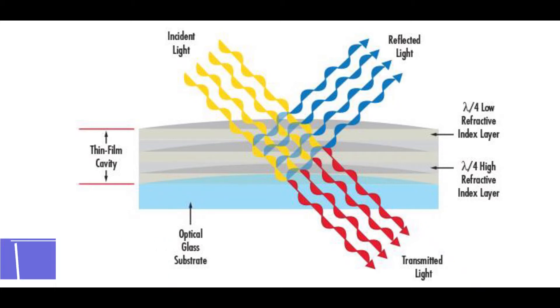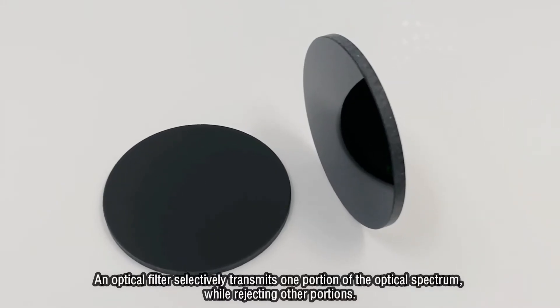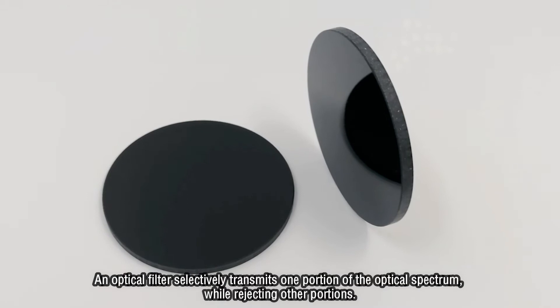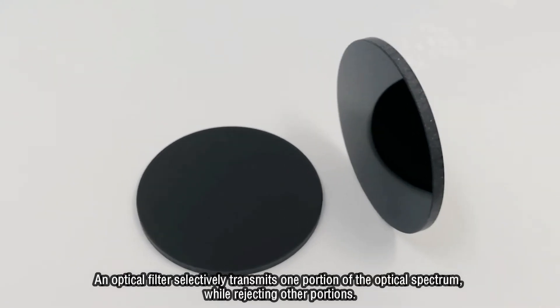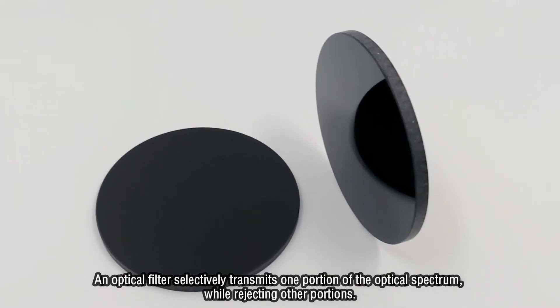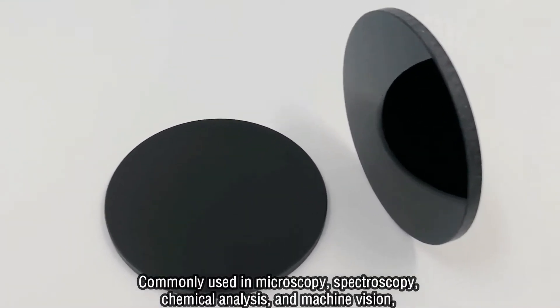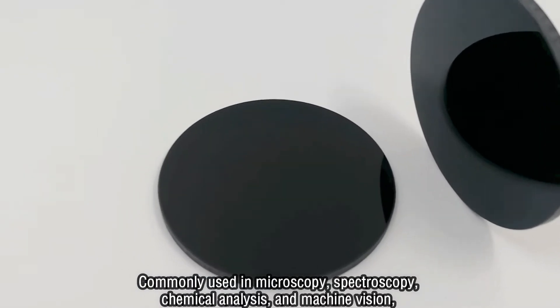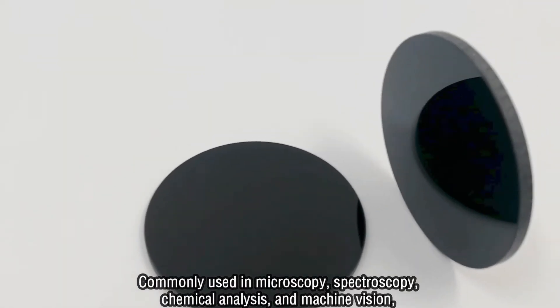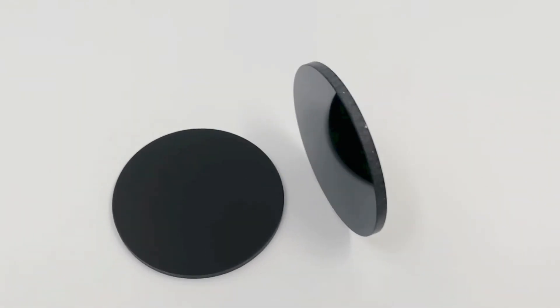An optical filter selectively transmits one portion of the optical spectrum while rejecting other portions, commonly used in microscopy, spectroscopy, chemical analysis, and machine vision.